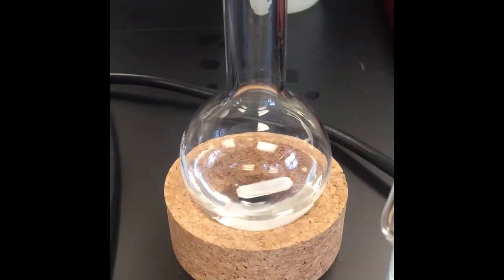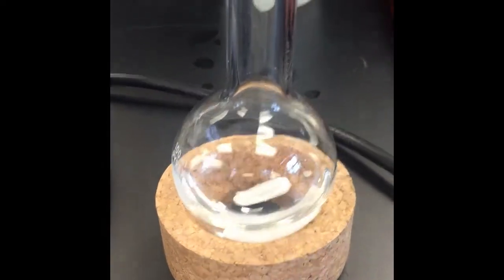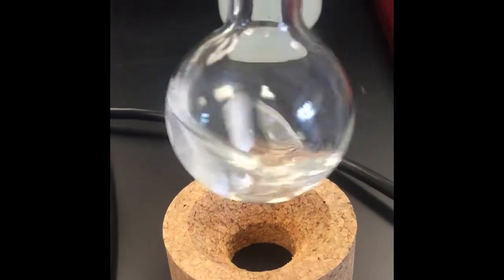Now after this is boiled for a while I'm going to let it cool down a bit so it's close to room temperature, and as you can see everything is dissolved.